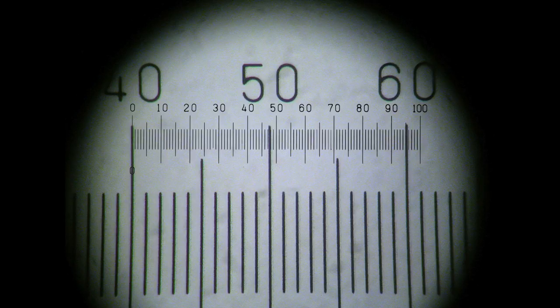Although you can actually see these numbers, they are irrelevant here. It is the actual number of units you can see that is important, and in this view, I can see a total of 27 units clearly from side to side.